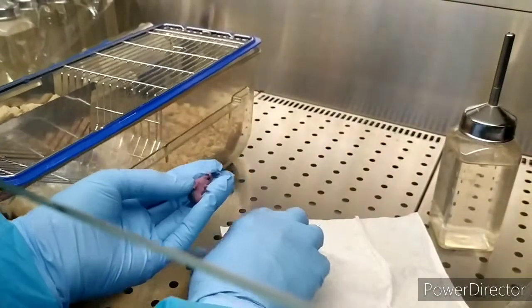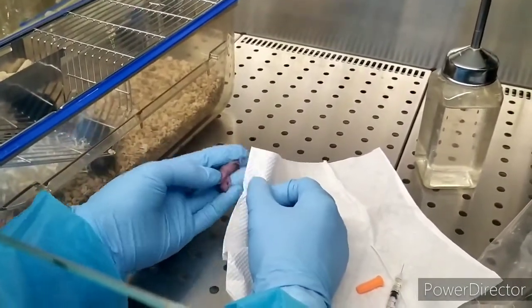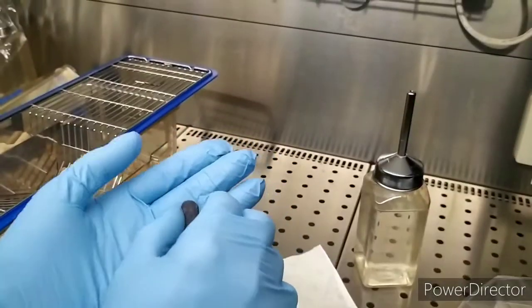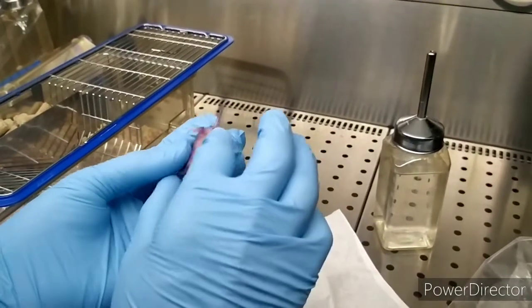A little bit leaking out. Actually, there's one piece of paper in my pocket, and then I bring it out. I forgot to take care. See? Finger, right? And then I inverse it — upside down. Hold the head and the tail.